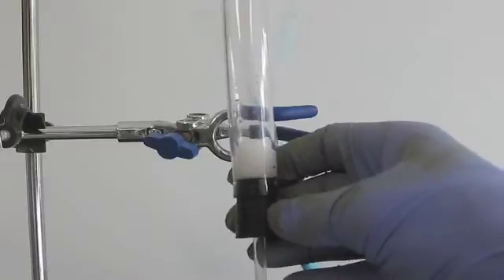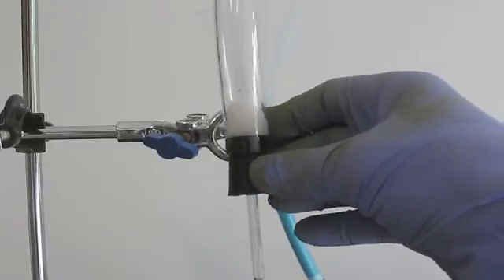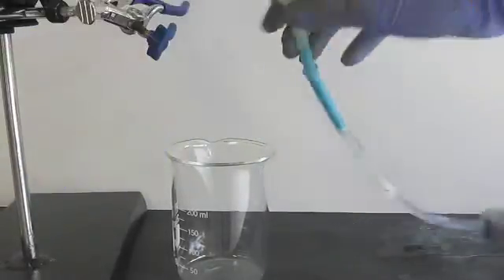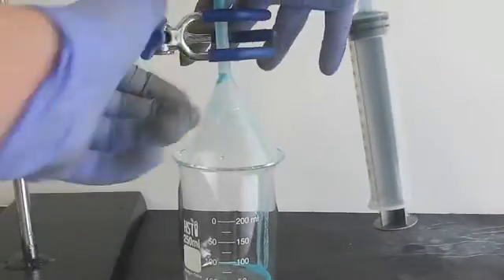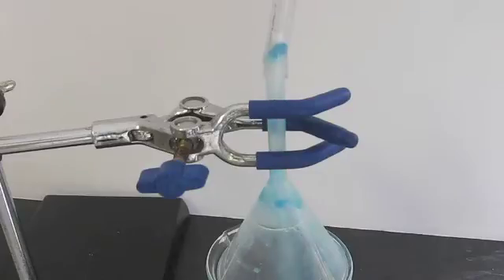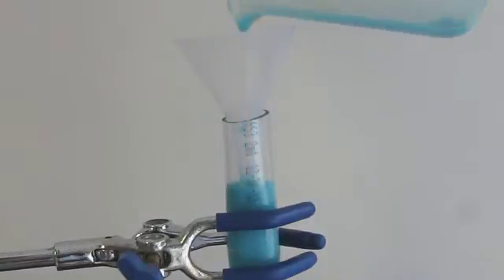Okay, so apparently the tubing I was using is way too narrow and the flow of liquid is painfully slow. So I will transfer it to this larger tubing with a piece of cotton at the bottom on top of a rubber stopper with a glass tube through it. I first remove the solids from the narrow tubing by inverting the funnel and placing it over a beaker. I then fill the syringe with air and use it to blow out the solids. I added some water to loosen the consistency of the solids and then transfer them to the new apparatus.